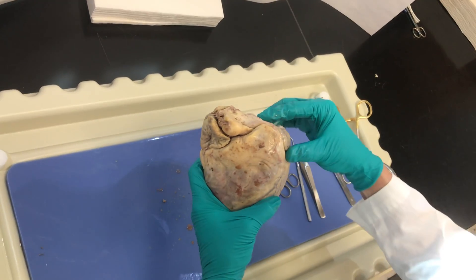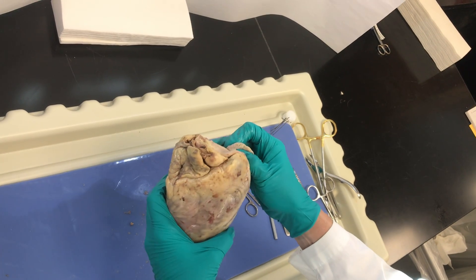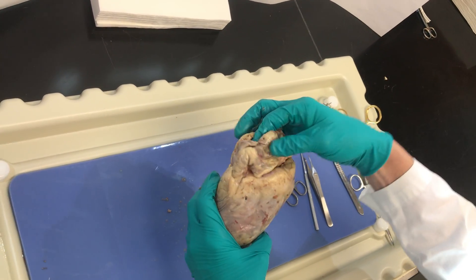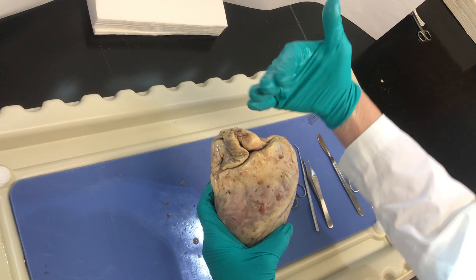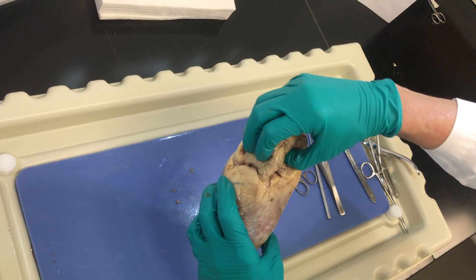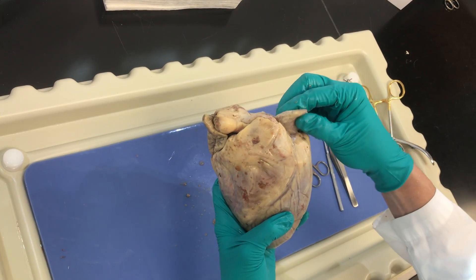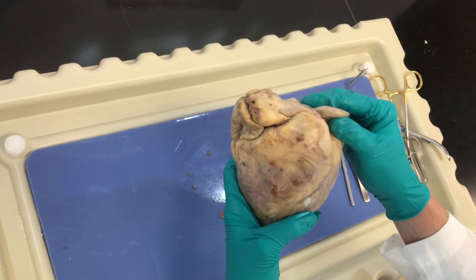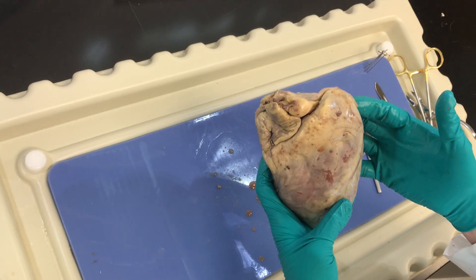Additionally, I should see these little flaps up here — they look like ears. They're actually called auricles, which kind of stands for ears because they look like ears. These are going to be extensions off of the atria. This is my right atrium and right auricle, which is off of the right atria, and then this is my left auricle, which is off the left atrium.